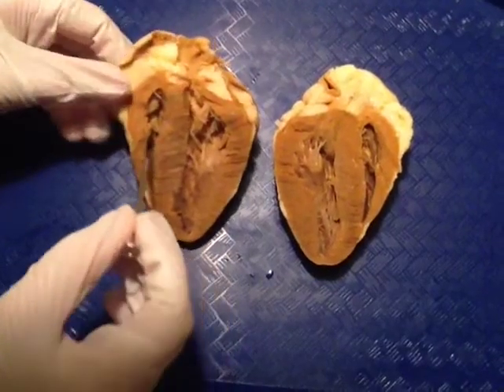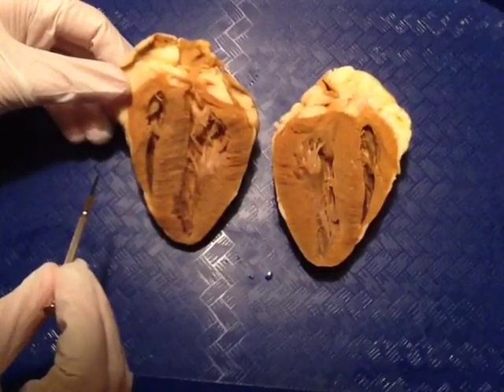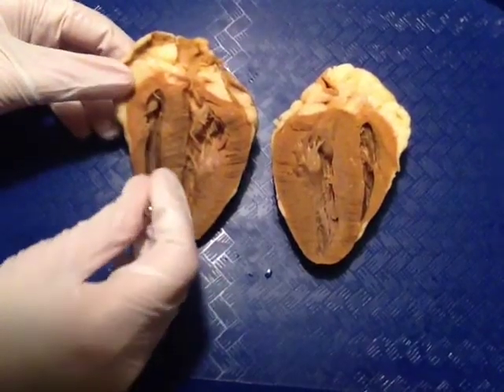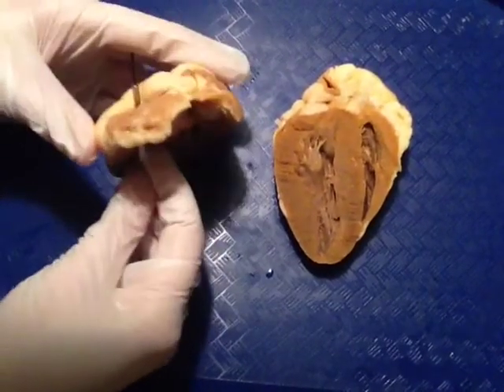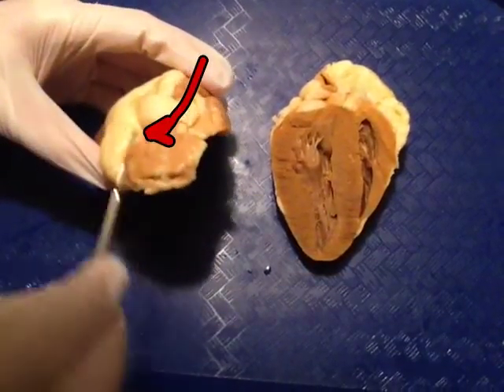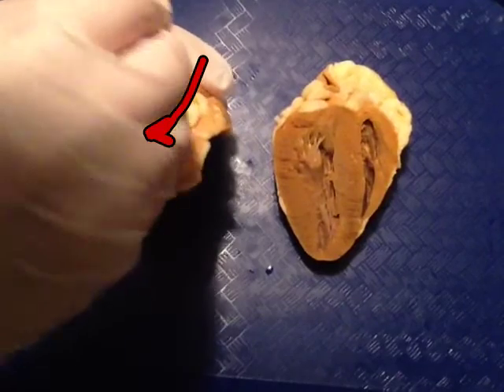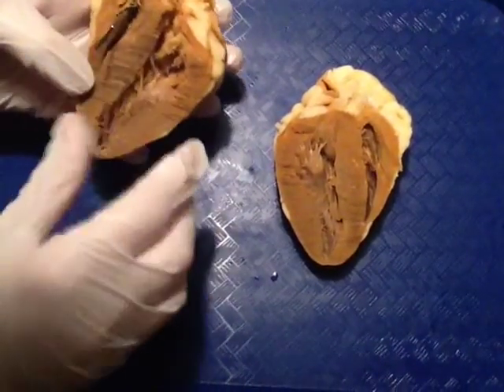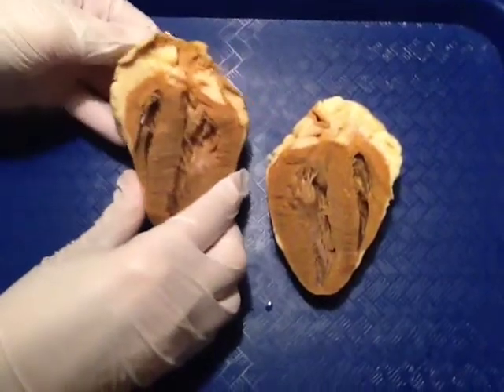The third major blood vessel is on the right side of the heart. The right atrium leads to the third major blood vessel, which you can see right here. Again, leading into the right atrium.